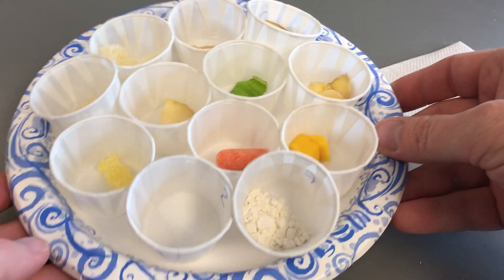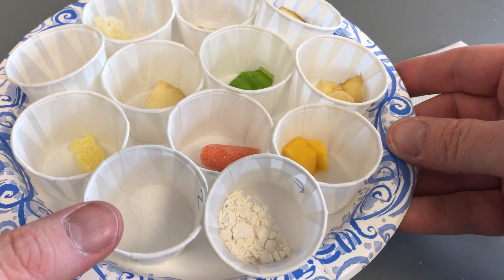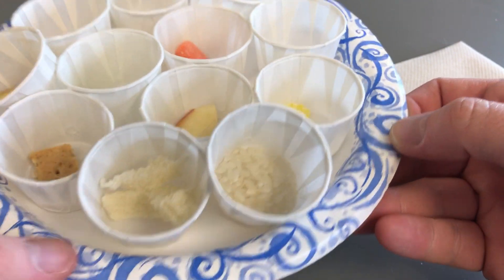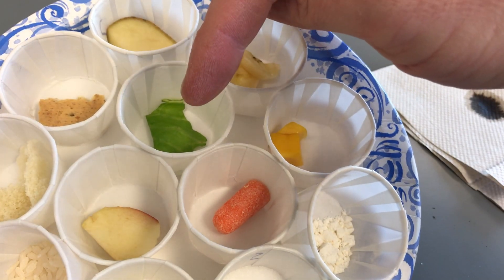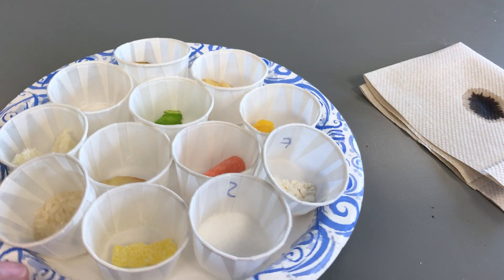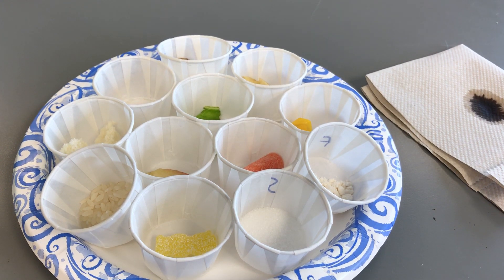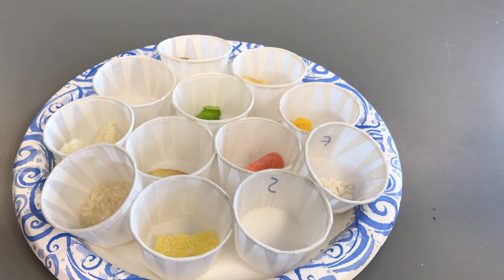The samples we're going through include sugar, flour, mango, banana, potato, graham cracker, bread, rice, sour patch kid, romaine lettuce (instead of spinach), carrot, and apple. Pause the video now if you need to fill in your predictions. I'm going to run through all the results for those who missed the lab or want to review what happened.